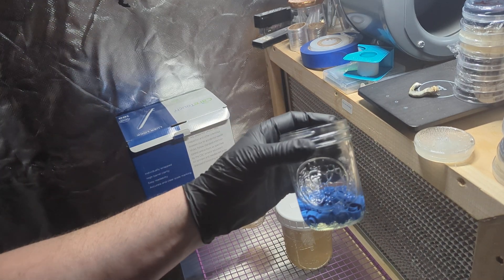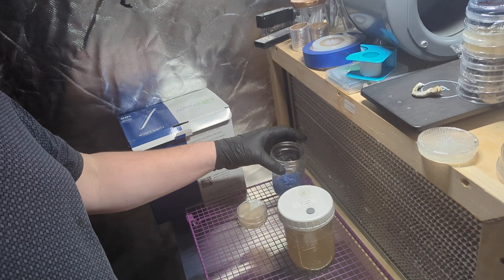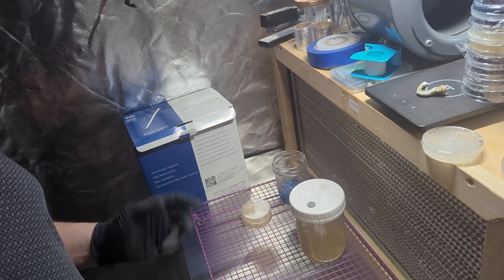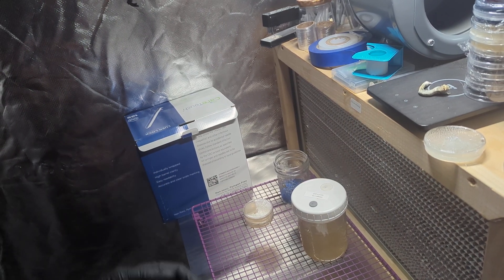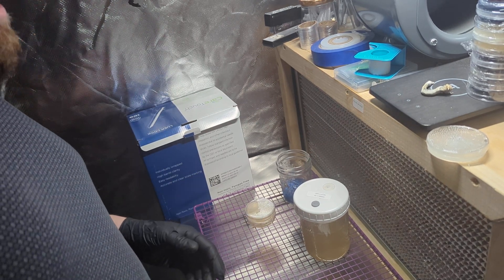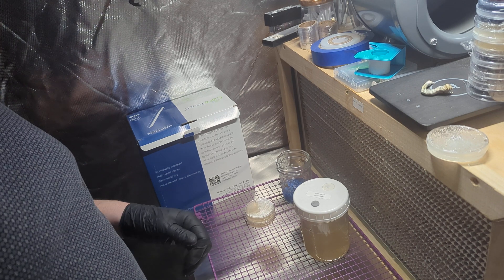I realize I'm limited to the amount of caps I have, so I'm only going to be doing 20 — two different varieties. I apologize to anybody who's been waiting. I have more caps coming this coming Tuesday, so hold tight, they will be there soon.